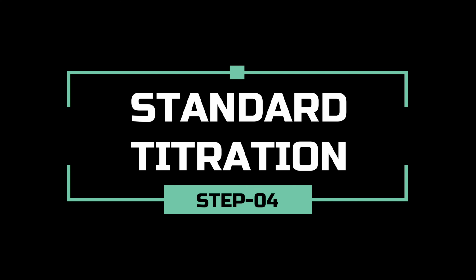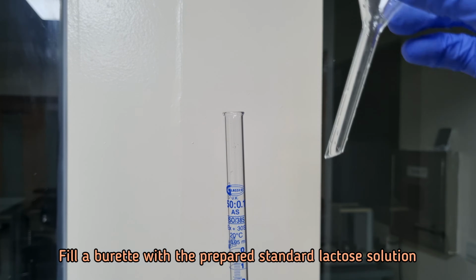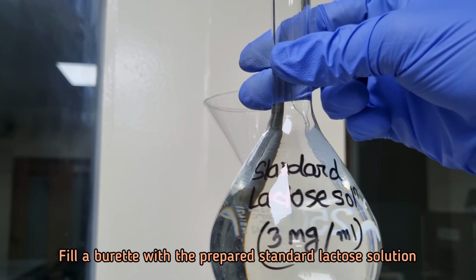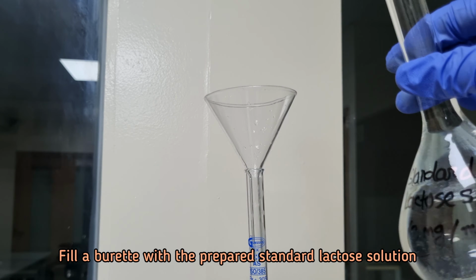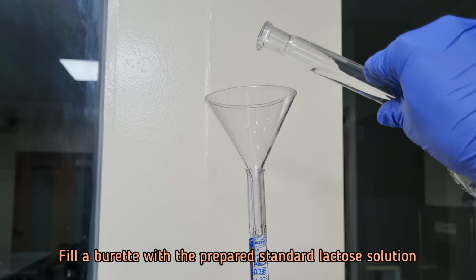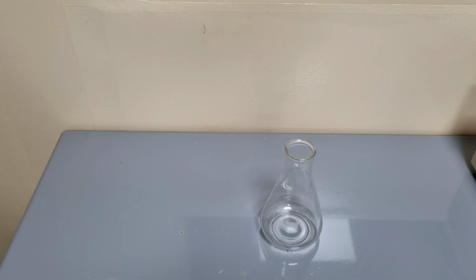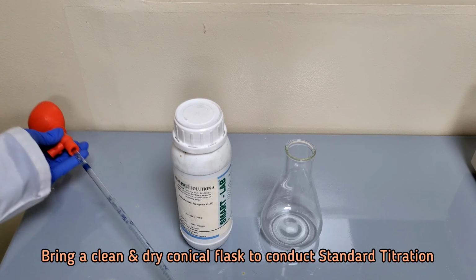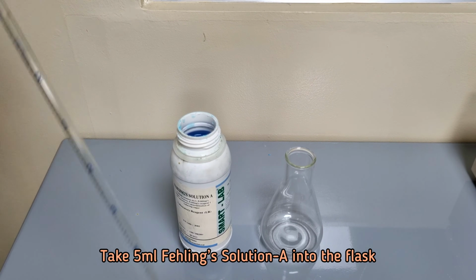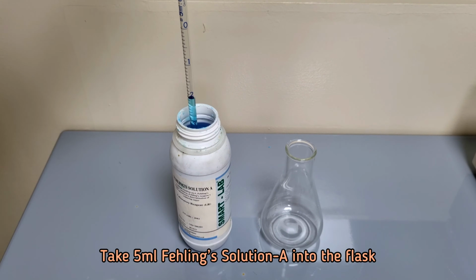In this step, we will carry out a standard titration. Fill a burette with the prepared standard lactose solution. Take 5 ml Fehling solution A into a clean conical flask.